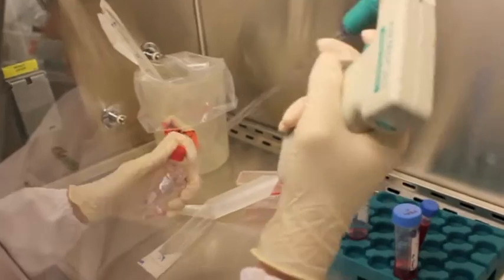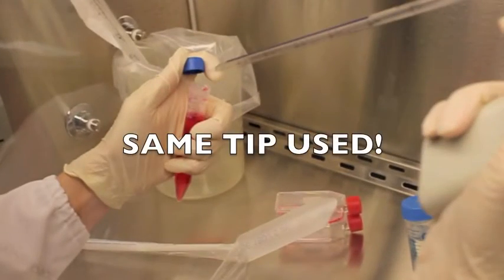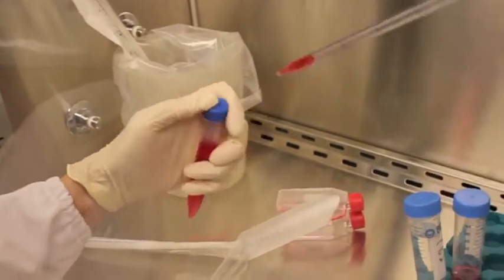In cell culture, aseptic technique must be observed at all times. As such, you must not use the same pipette tip for the different solutions you use.